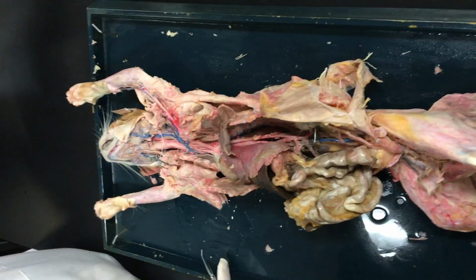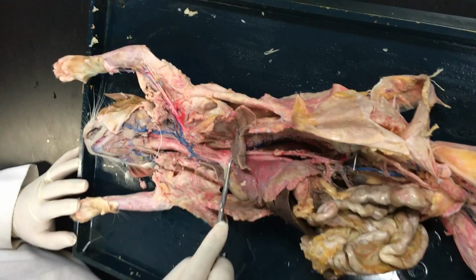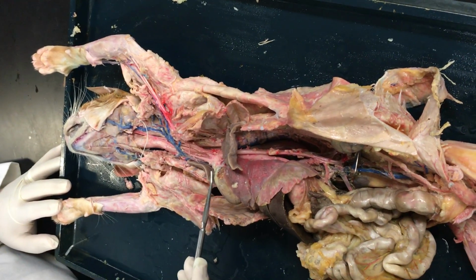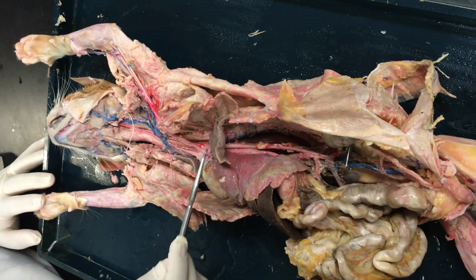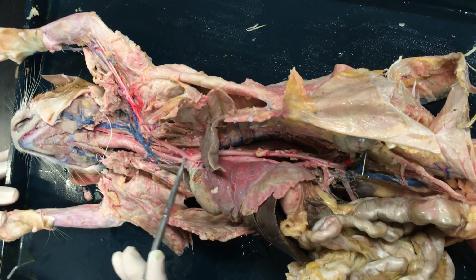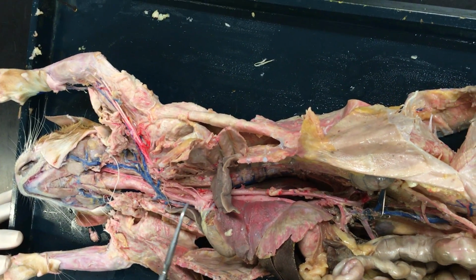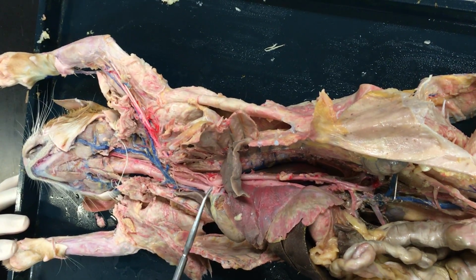So I'm just gonna start just coming off of the heart here for the arteries. Remember, the arteries are supplying, so this is gonna be going out. As we exit from the left ventricle, the blood is gonna move into the aortic arch. From the aortic arch here on the cat, you see two major branches: the brachiocephalic branch and the left subclavian artery. In humans, please keep in mind that there is a third branch here, the left common carotid.